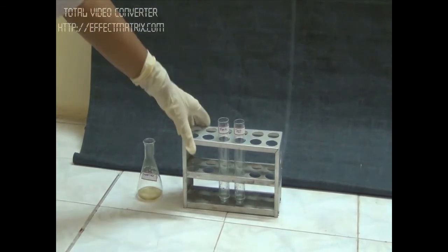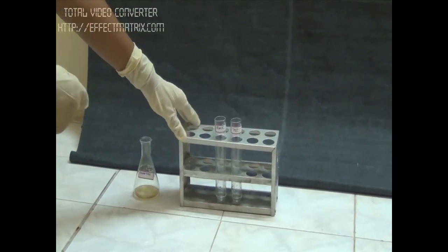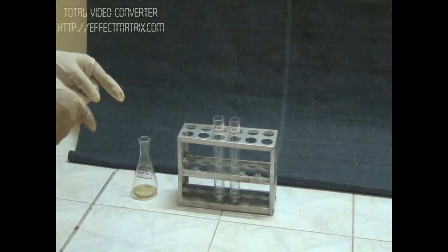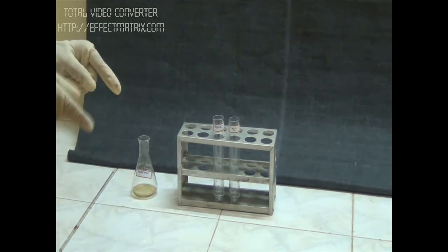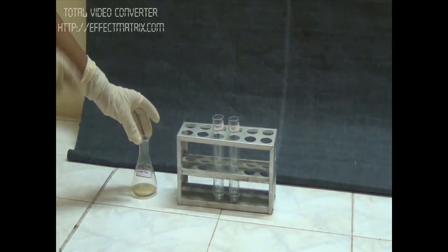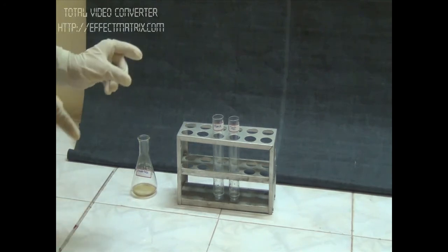Incubation is complete. We incubated at 55 degrees for 15 minutes because invertase has an optimum temperature of 55 degrees.